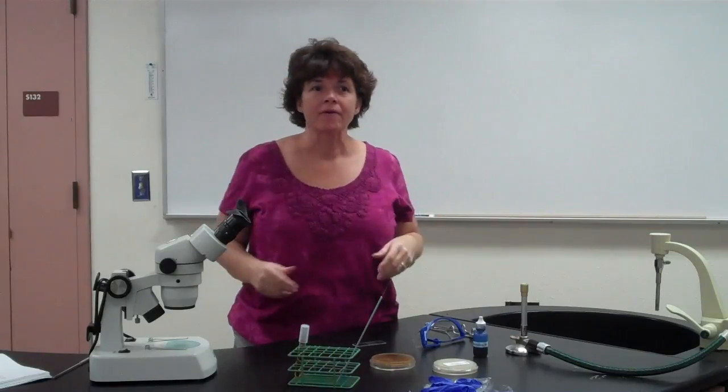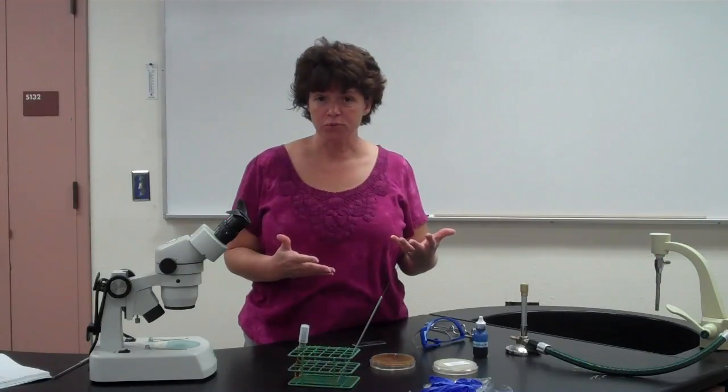Now remember we talked about the different groups of asexual and sexual spores. We talked about sporangiospores, which are the ones that were enclosed in that sac, like you put a little helmet on your head, and then there were the conidial spores, which are the ones where they're not enclosed in a sac and they just kind of shoot off the top of that aerial hyphae. So we're going to be looking at those as well as the sexual spores.